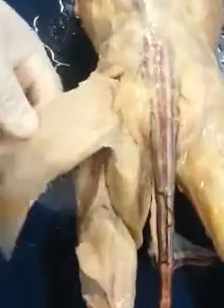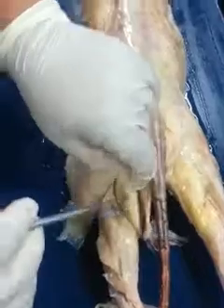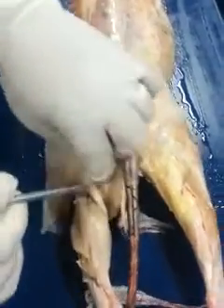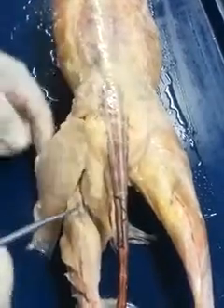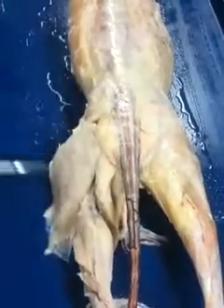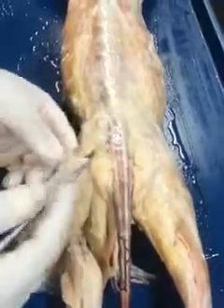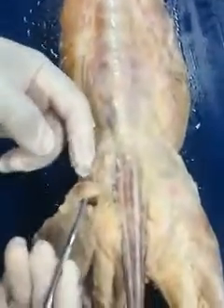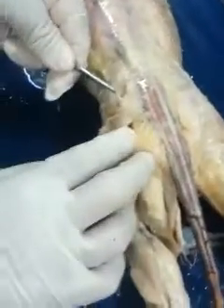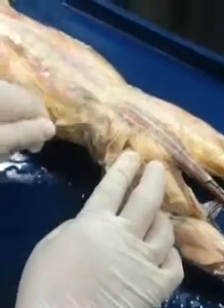Now we might start making our way back up towards the caudal end, and here again we see the semitendinosus, semimembranosus behind it, and then the biceps femoris. And these then make up the hamstring group, which is going to allow you to flex the knee. Okay. Continuing in this direction, you have your caudofemoralis, which is also only found in cats, not humans. Then the gluteus maximus, and then the gluteus medius.